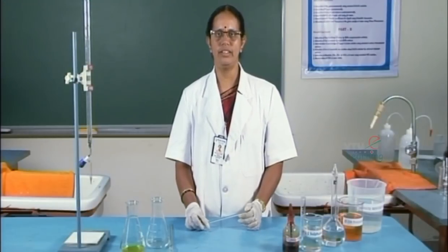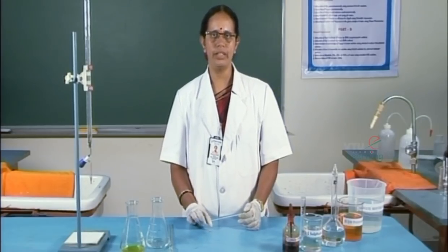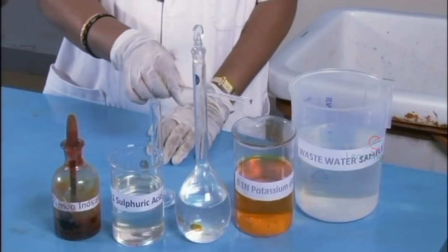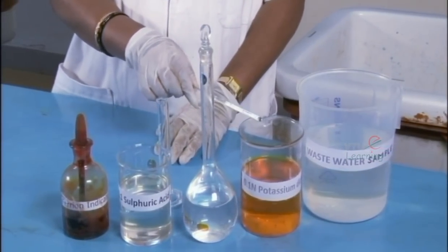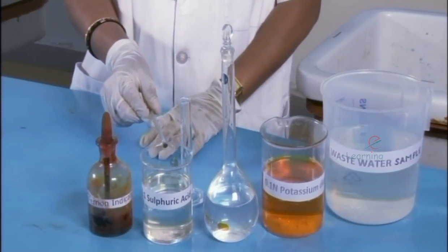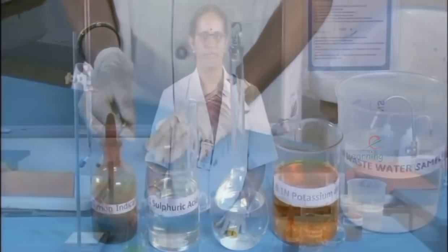Now, let us see the conduction of the experiment. The reagents required for the experiment are as shown: the water sample, the oxidizing agent — potassium dichromate solution — standard FAS solution, 1 is to 1 sulphuric acid, and the indicator used is ferroin indicator.